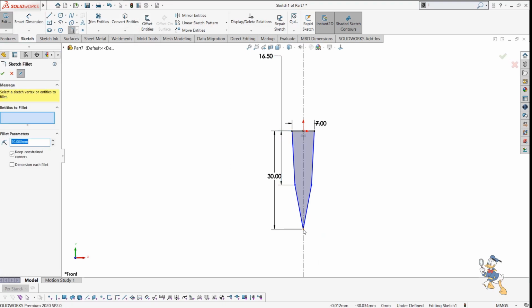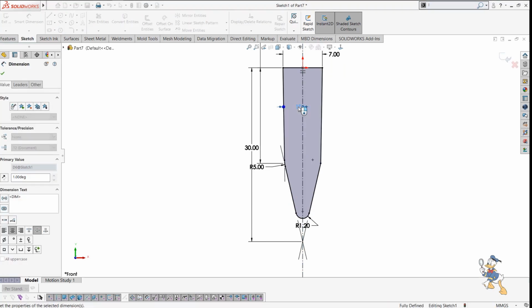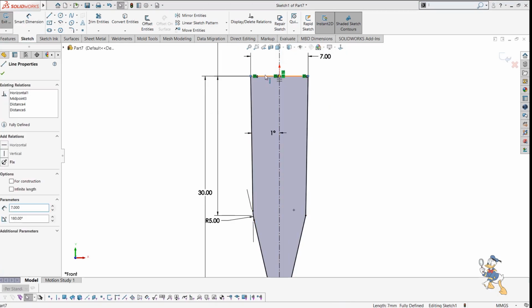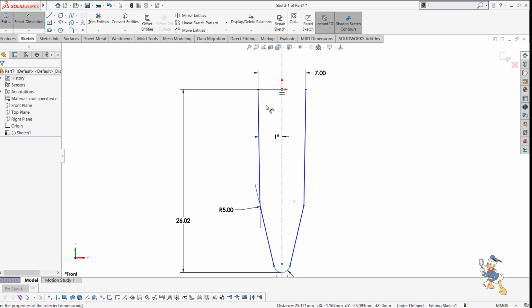I just need to provide some fillet as well. I just need to provide a fillet of 2 mm, or we can say 1.2 mm over here. That is okay for me right now. And I need to generate a 5 mm fillet over here. It is okay for me. And suppose I just need to provide the angle with this. I will provide the angle of 1 degree. And then suppose I just need to delete this one. We can delete this one as well, and I can define the whole sketch from here.